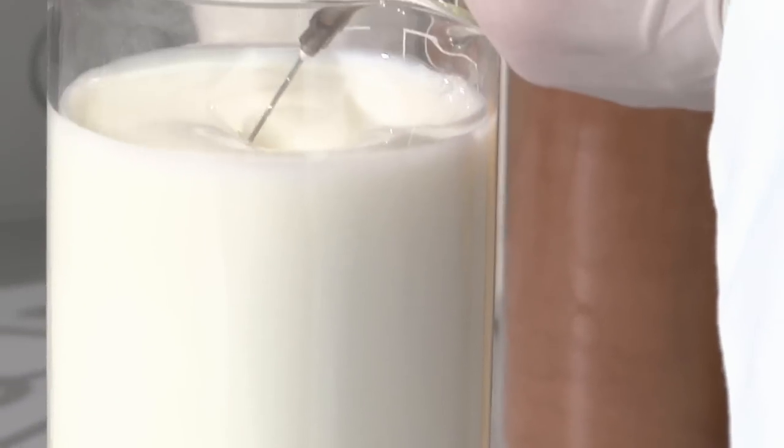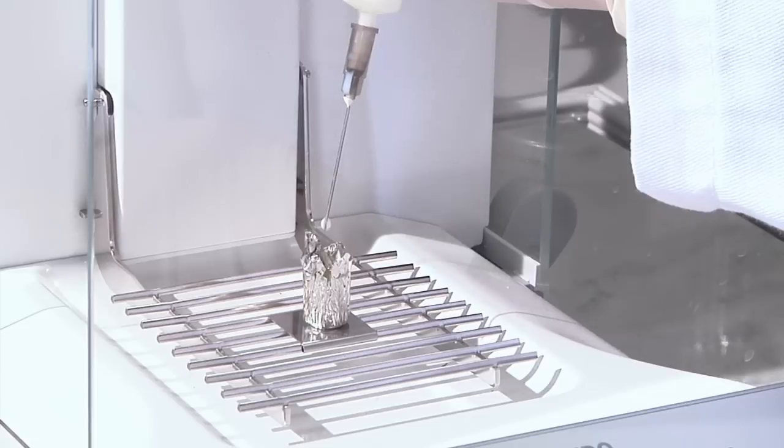In the case of liquid samples, the sample preparation procedure remains very similar with the only addition of an inert material.